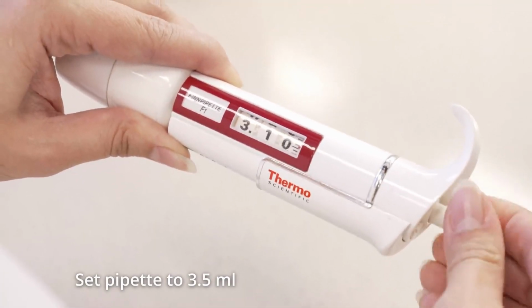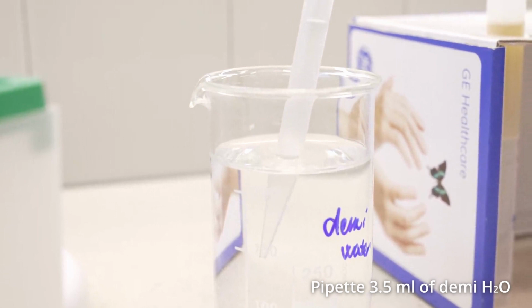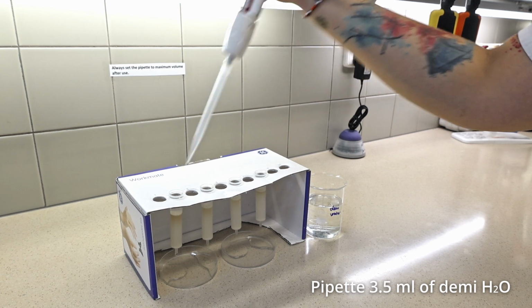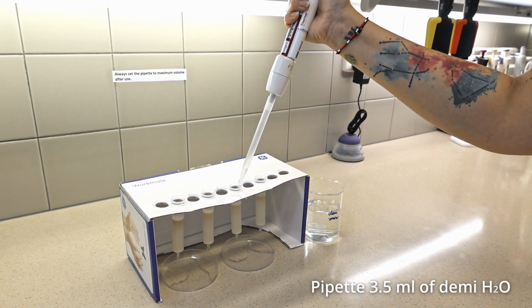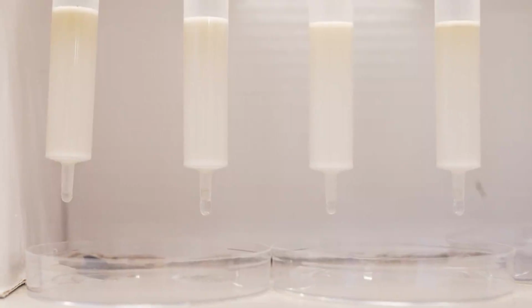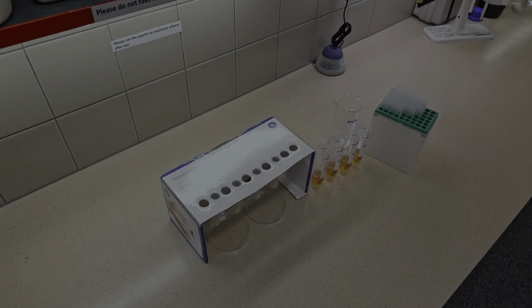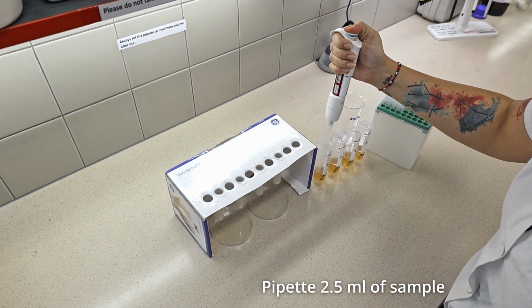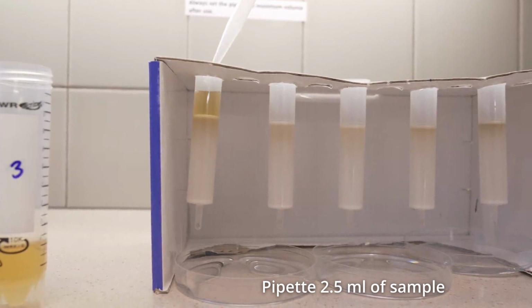Pipette is set to the volume of 3.5 milliliters, and demineralized water is introduced to the columns. This water serves to flush the columns. When water stops dripping, the sample can be introduced. 2.5 milliliters of the sample solution is pipetted into the column. The leachate is still not collected because flushing water is pushed out from the column by the sample solution.